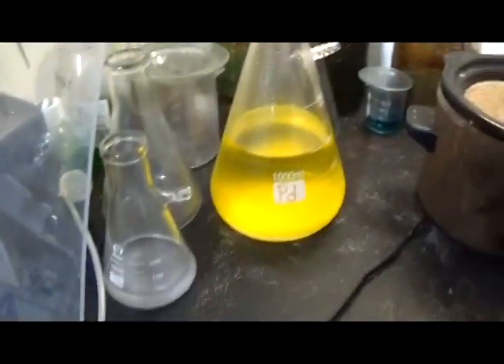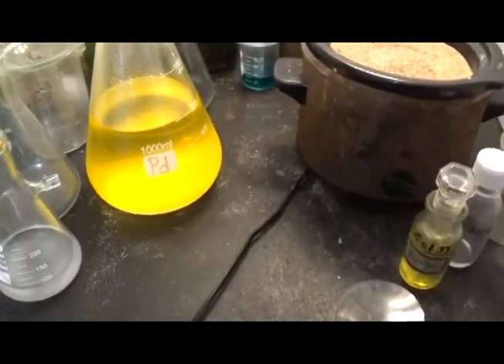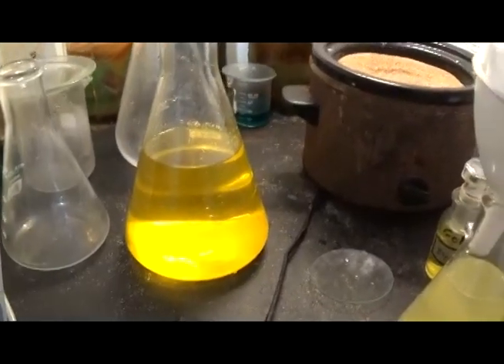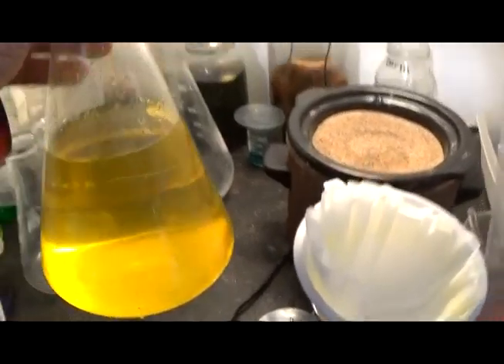Let's get onto the furnace. Let's get this over with. You know, I don't want to spend two weeks doing this. I got things to do, you know? Okay, filtering operation, what, about 246?